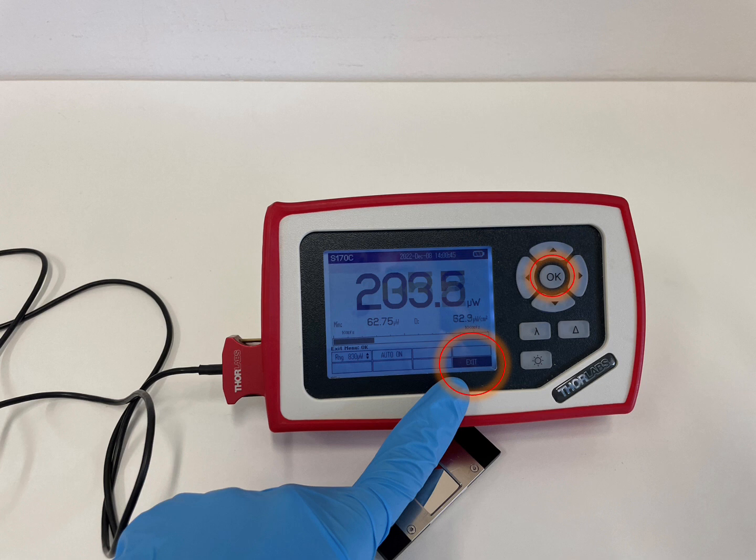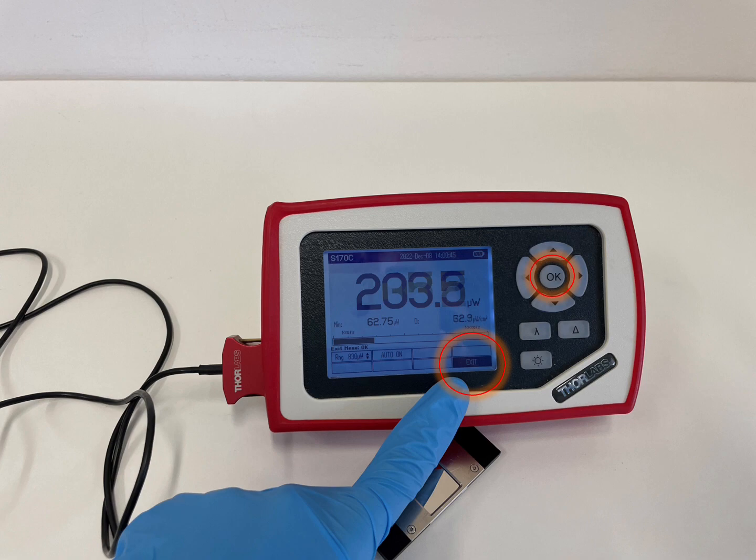You are now ready to place the powermeter sensor on the microscope as described in the next tutorial.